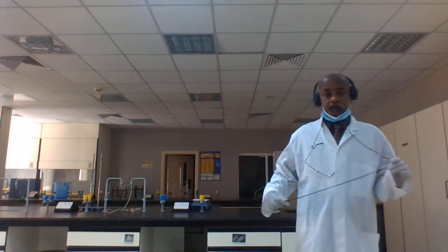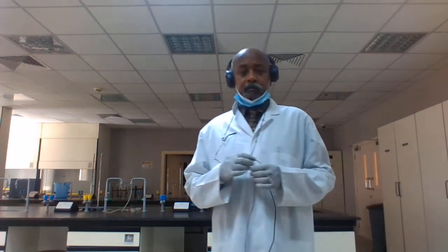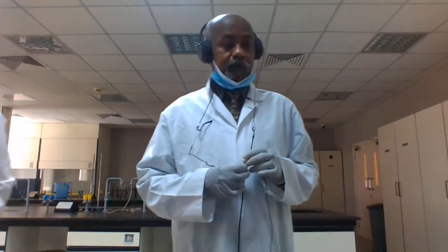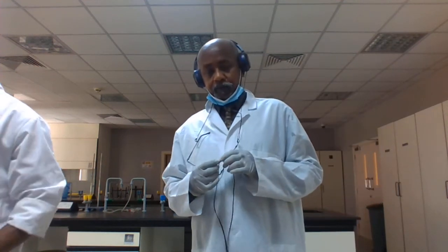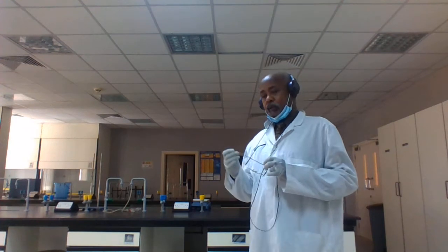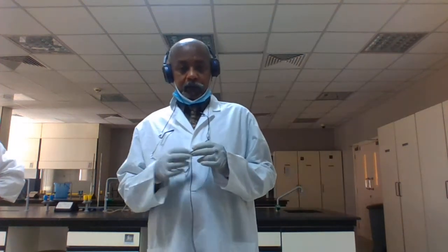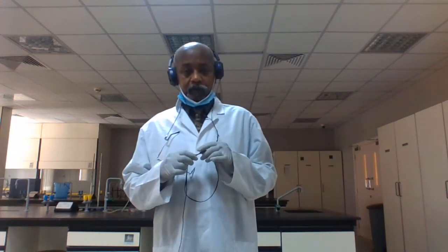Today in our organic chemistry lab we will demonstrate our second experiment: identification of organic compounds in macroorganisms. That means the organic compounds that are in our body as macroorganisms. A macroorganism is already known to you.